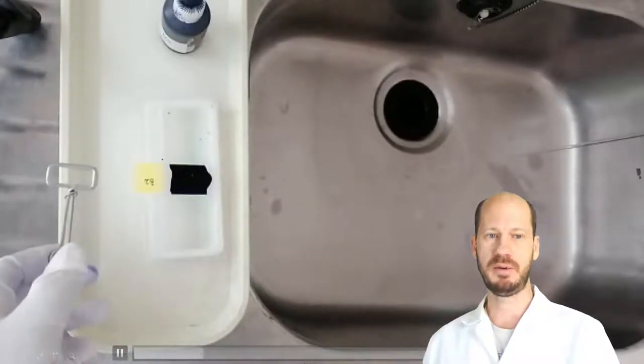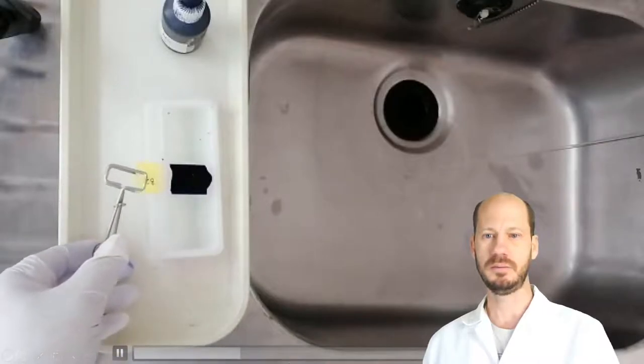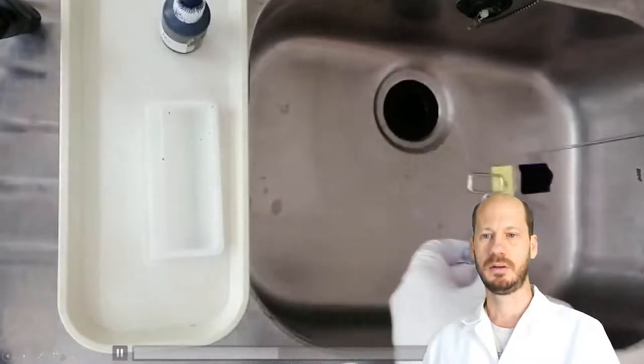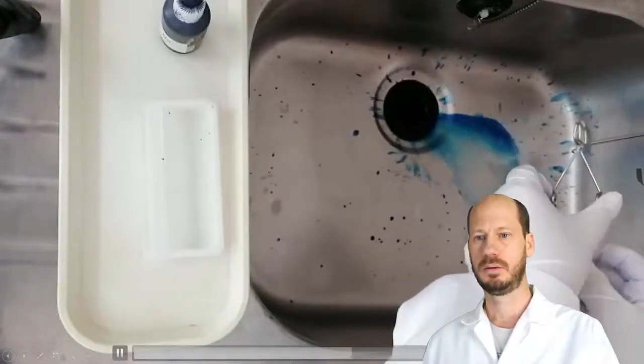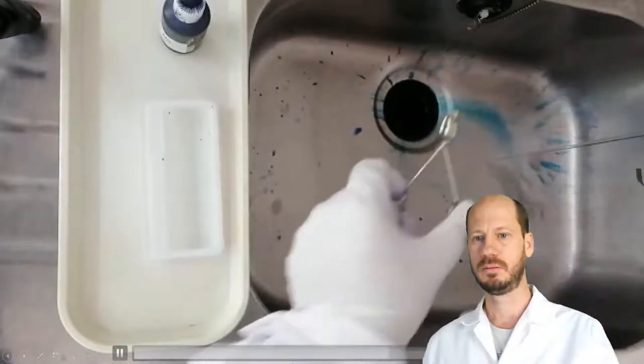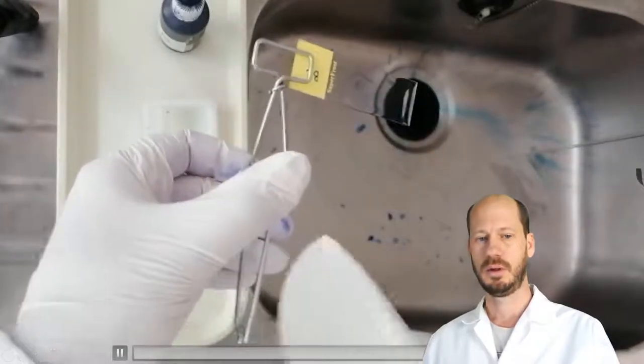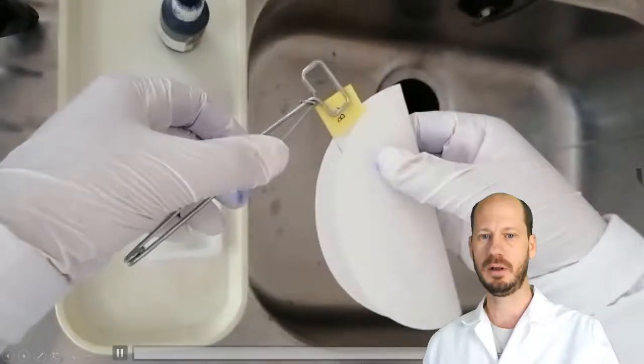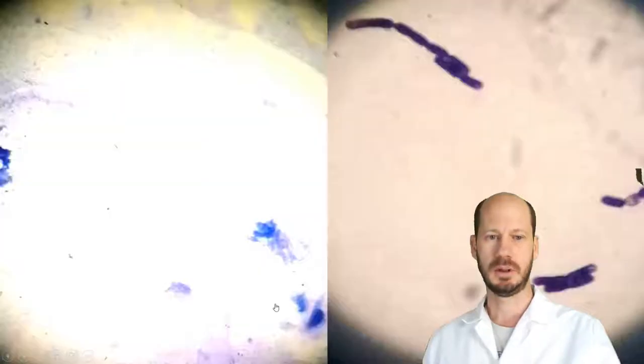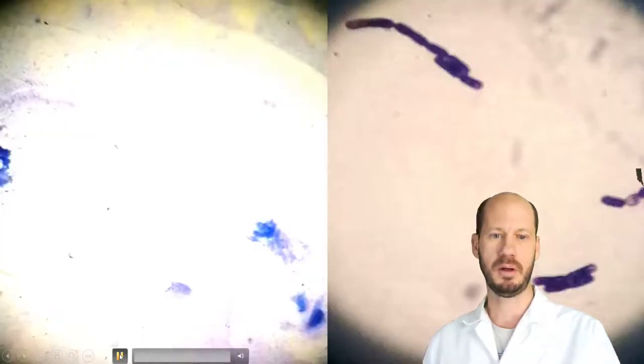Next step of removing the safranine. And then we are ready to go. Dry it up with filter paper. And let's go for the microscopy.